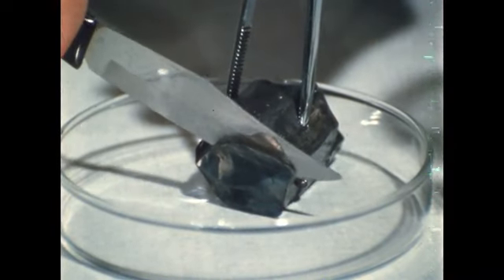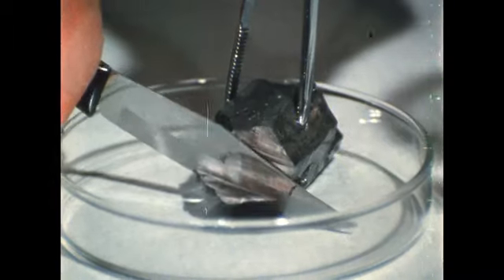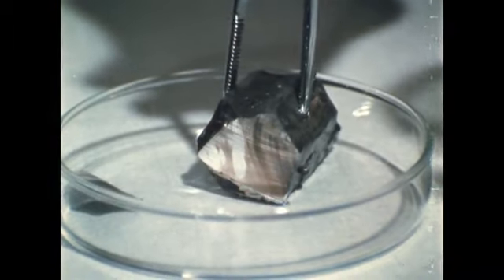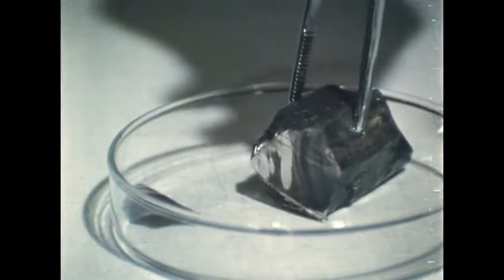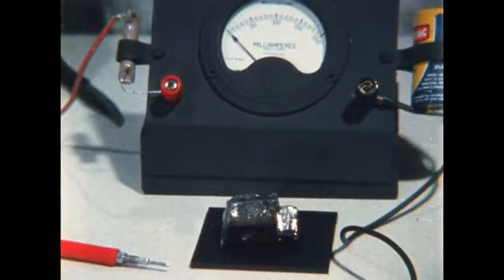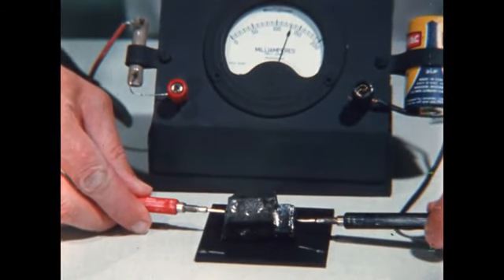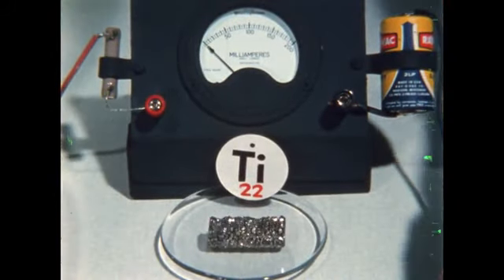Lithium is somewhat ductile and looks metallic. The clean surface, like that of potassium, reacts with air. The lithium turns black except where covered with oil. The shininess and ductility of lithium indicate that it is a metal and should conduct. It does. We proceed with the task of sorting elements into metals and nonmetals.